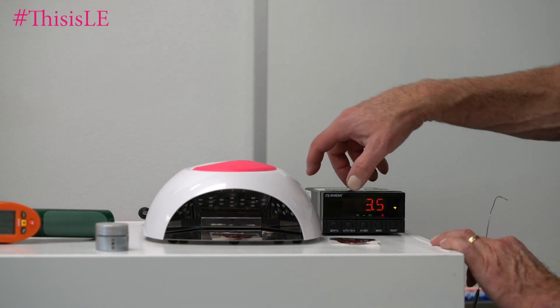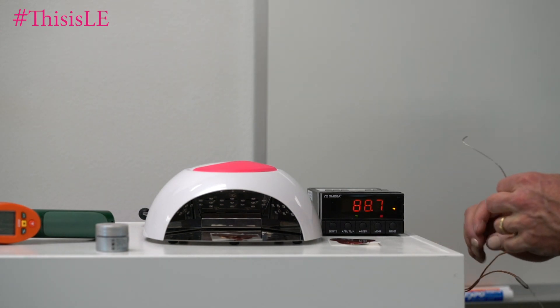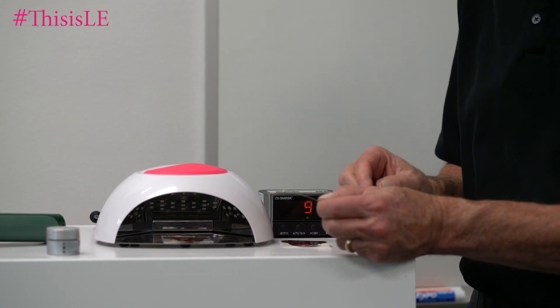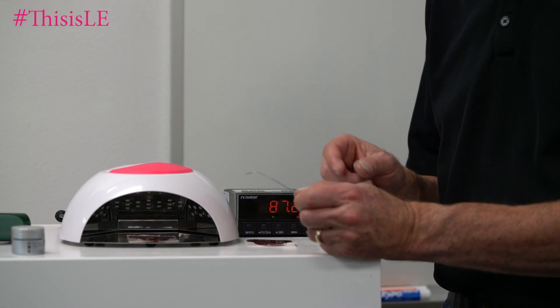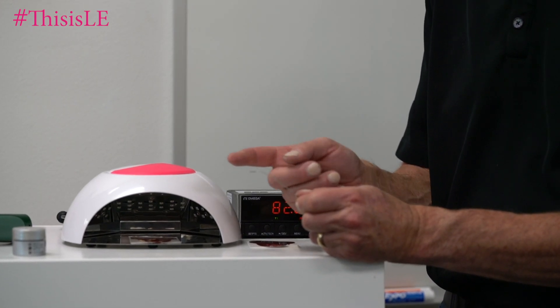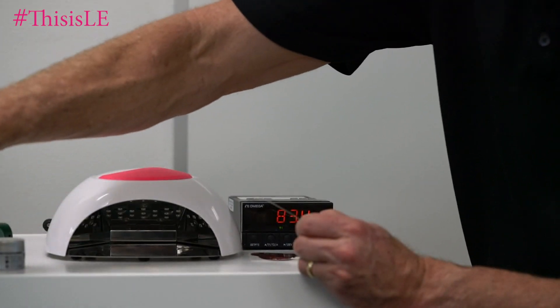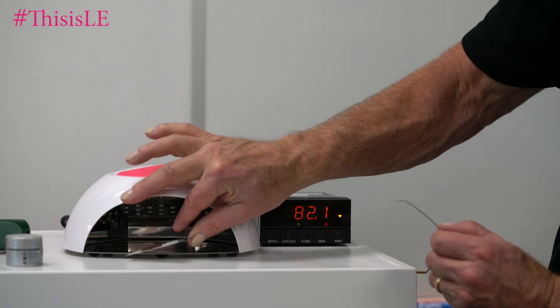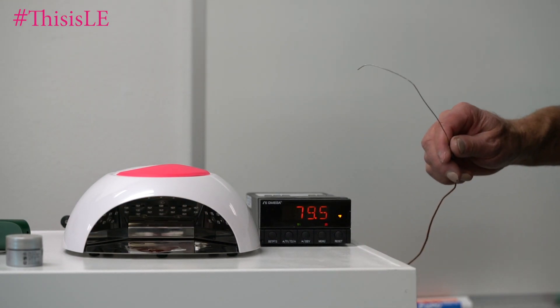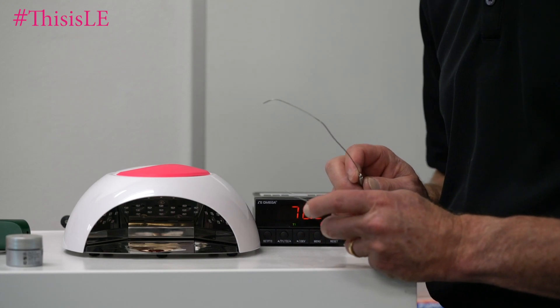Now, if you happen to use a digital one — make sure I have the right probe. So this is the size of our thermocouple; it's very, very small. Comparatively speaking, some of the other ones we use in the QC lab are about a sixteenth of an inch across, where this one here is just maybe one-quarter of that thickness. We're going to take this sample of gel out, put this sample of gel in, and I'm going to turn this to 60 seconds. I'm going to measure the amount of heat being generated using one thermocouple.